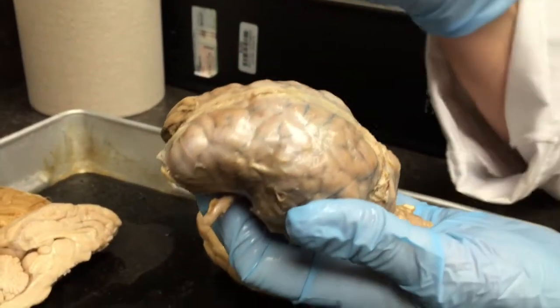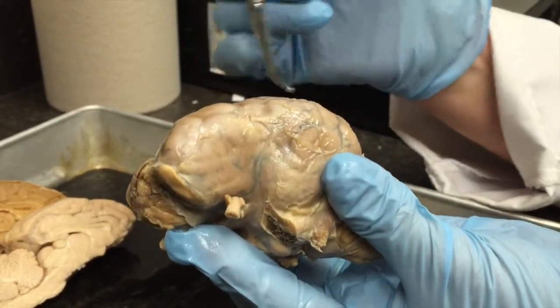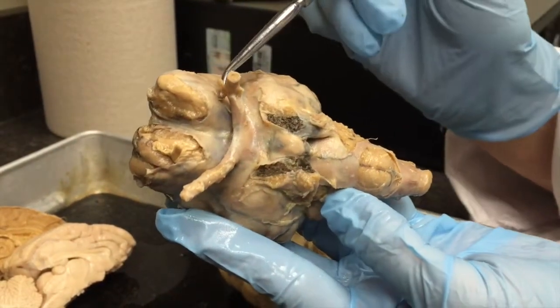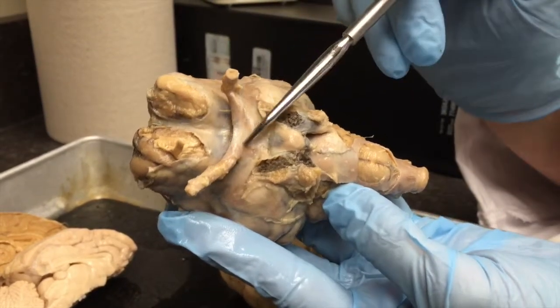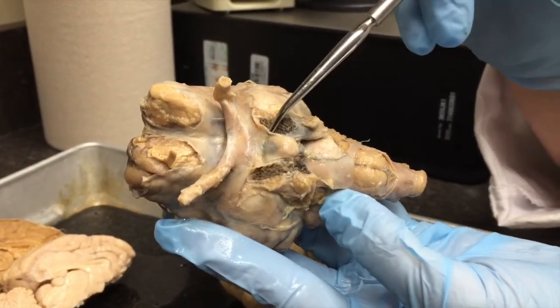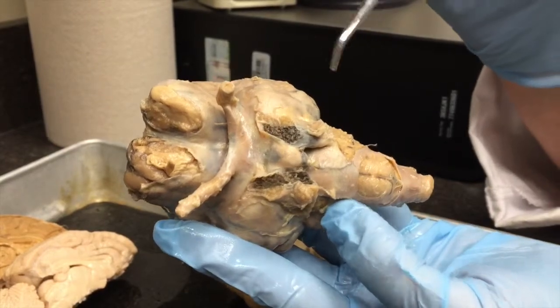Today we're going to look at the sheep brain, and this is a sheep brain that still has the Dura Mater on the surface, and you can see through the Dura Mater. If I turn that around, you can see the inferior view of the brain. When you have the Dura Mater intact, usually you have much longer optic nerves showing, and here's the optic chiasm. They also cut around the sphenoid bones so that they still have a pituitary attached to the inferior brain. So this is the pituitary gland on the sheep brain.